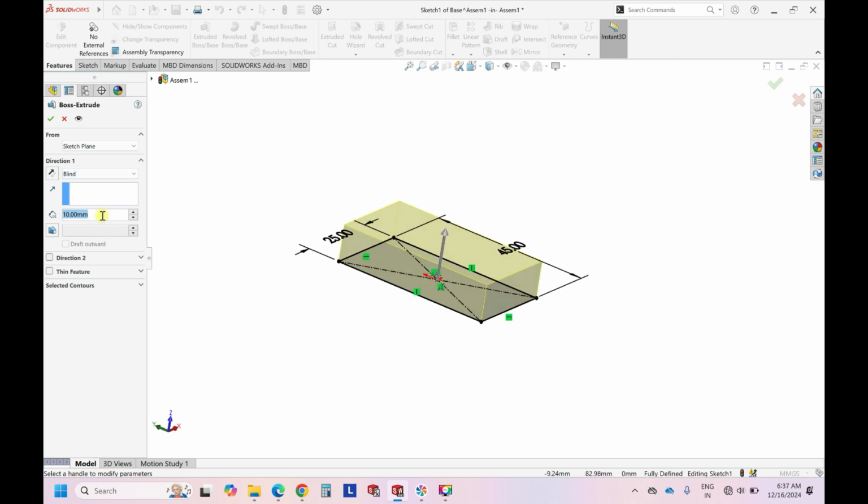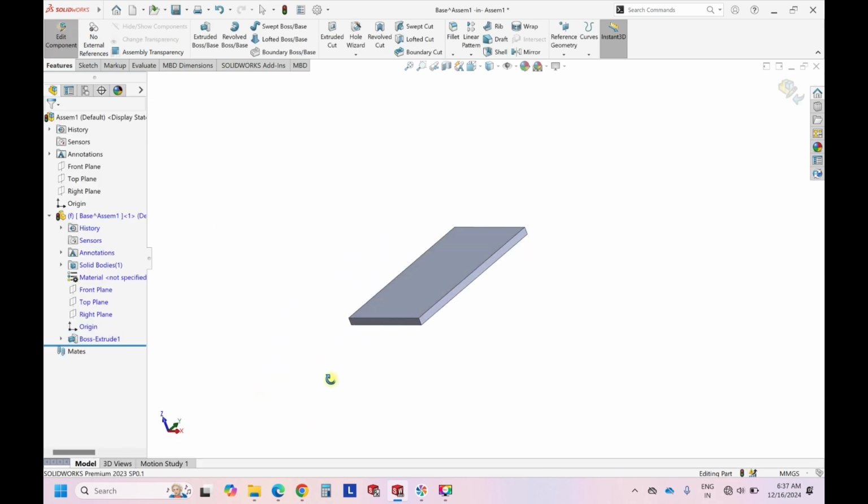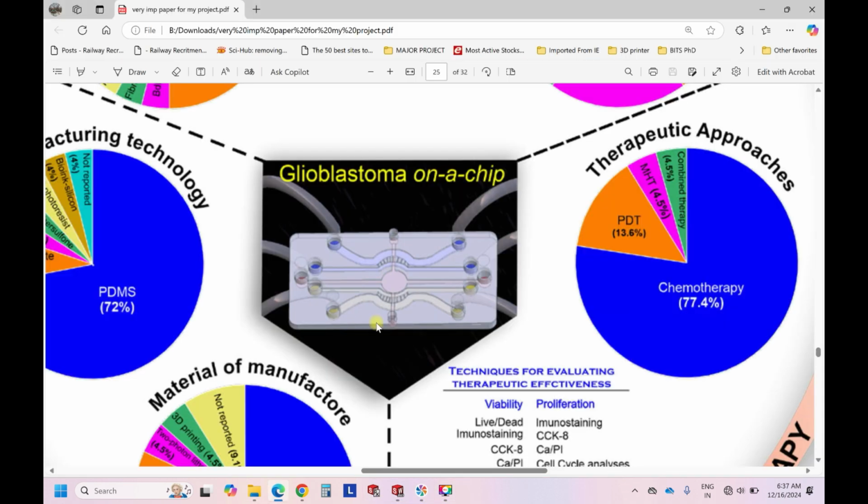or the channels. So we'll give it as 2 mm. So this is the initial one that we have already created. Now we have created this base of 2 mm, over which we'll groove these channels.